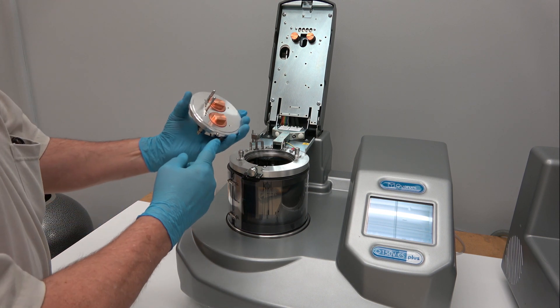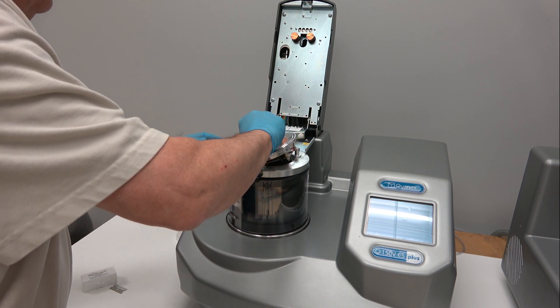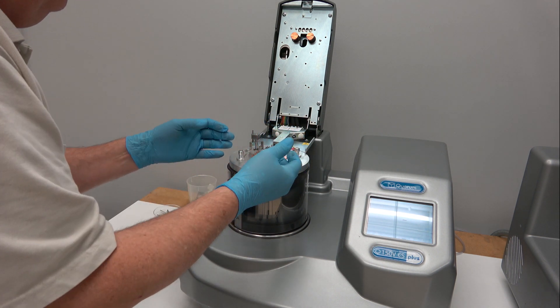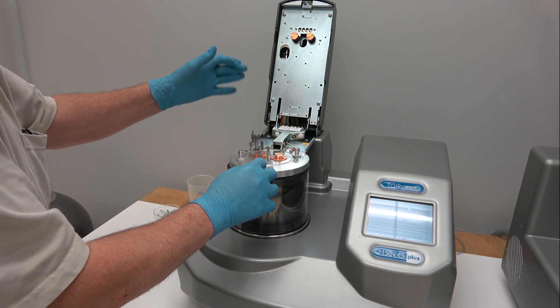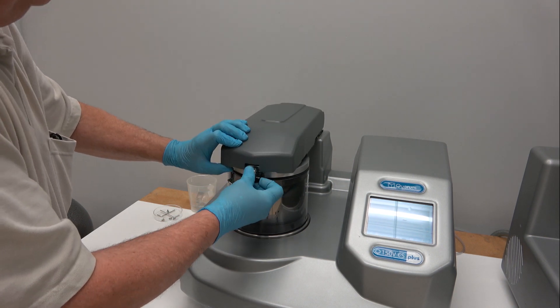The inserts have a set screw which fits in that hole, giving you some orientation. Because the carbon rod is a bit long, you will very gently insert it in that manner. Then you've got two locking screws which will hold it tight against the o-ring, and then we'll close the lid.